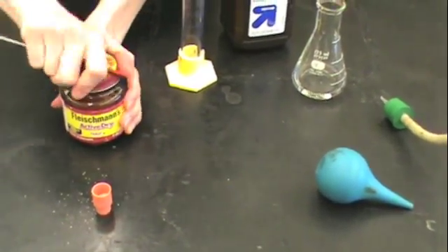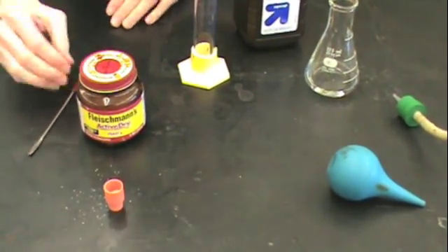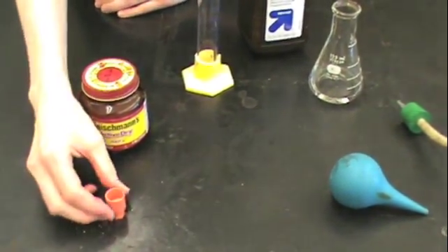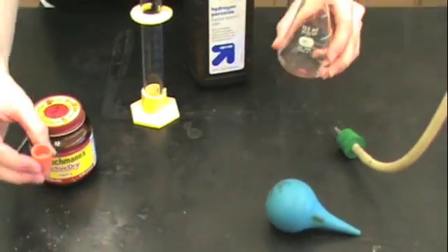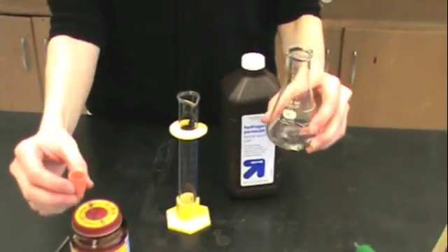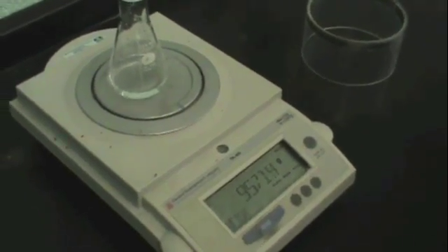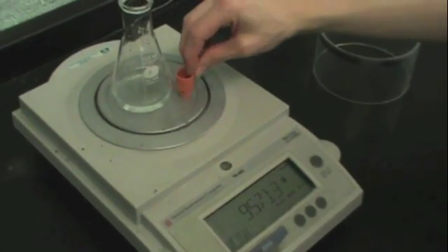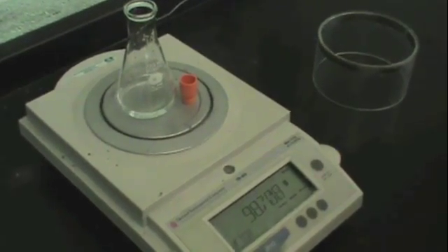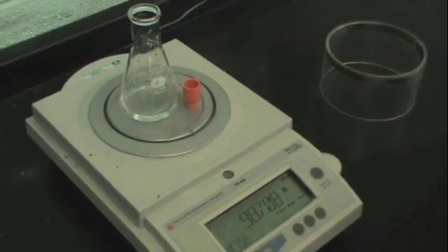Once you have added yeast to your stopper, take the stopper with yeast and your Erlenmeyer with hydrogen peroxide back into the balance room. At this point, you don't want your stopper in the flask yet. Then weigh out the Erlenmeyer with peroxide and then add the stopper. Record both of these values in your datasheet.